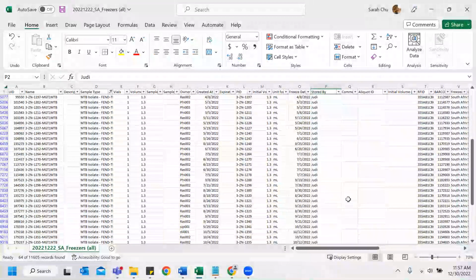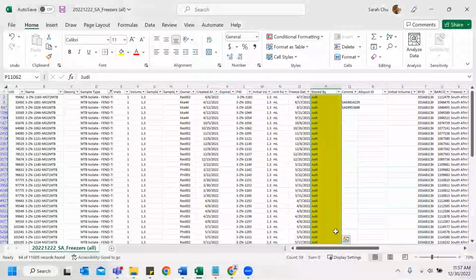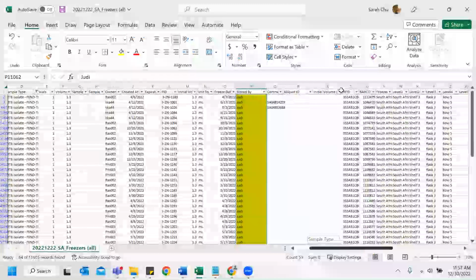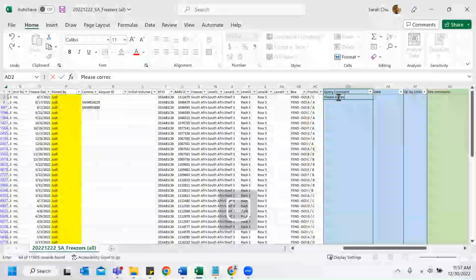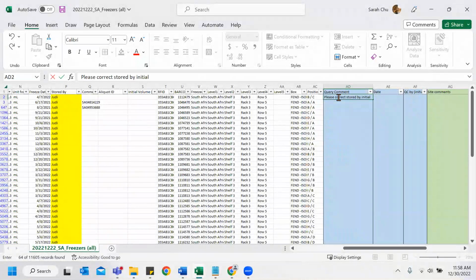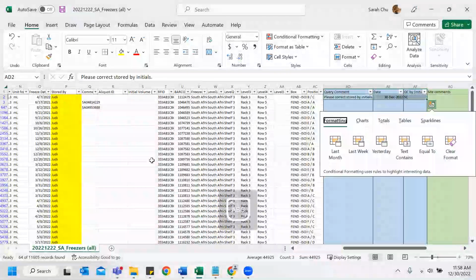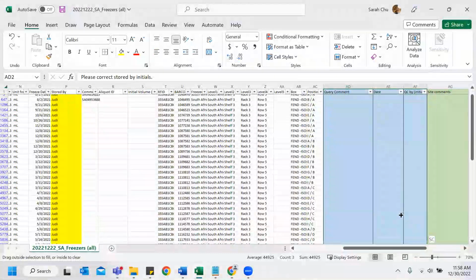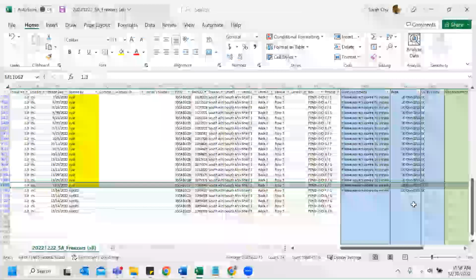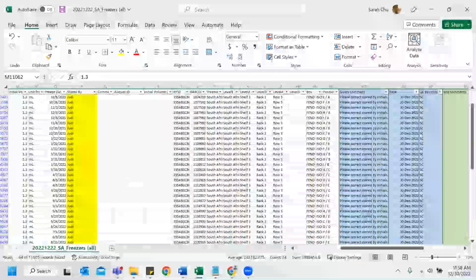Technically stored by should be initials. It should not be someone's first name, so that's an error you should immediately highlight. Highlight it. And then on the column, you just put please correct stored by, and then today's date is the 30th. Since all these are the same issues, I'm just basically going to drag. Make sure they align. Okay, perfect.